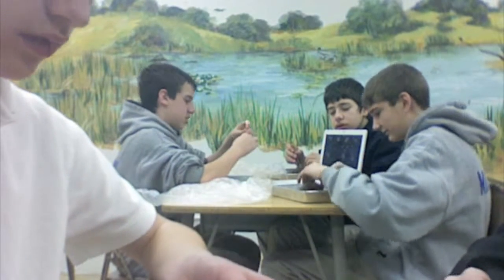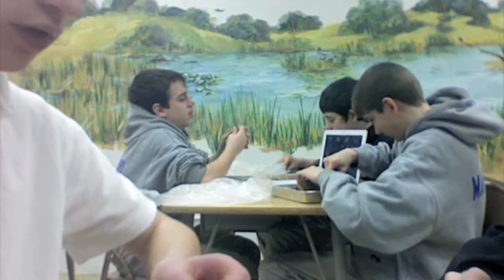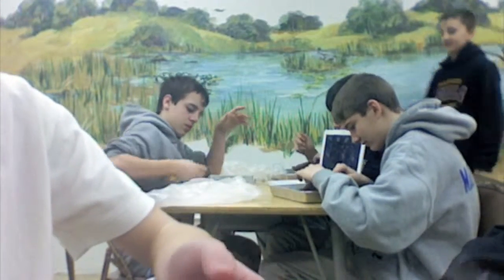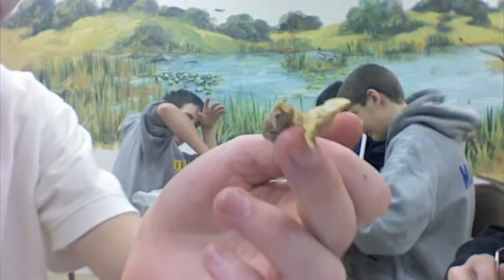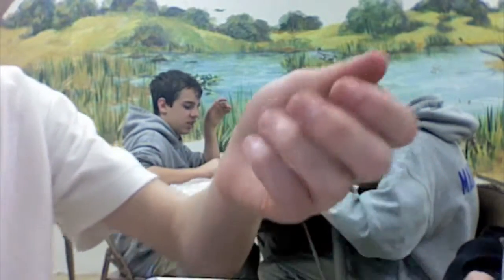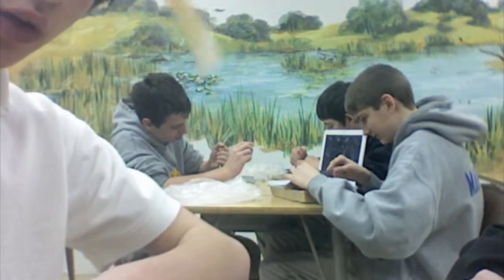Oh, Carter — Carter, the one on the left, couldn't find his fish's brain. He borrowed someone else's since they're disabled and couldn't do it. That's the organ — organs. Stomach, kidney, stuff like that. That's a large or small intestine. Don't know. We don't know at all.